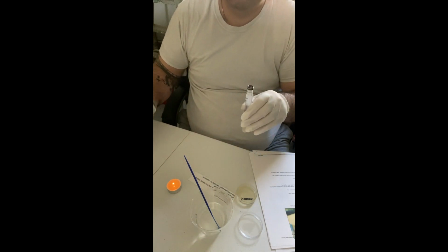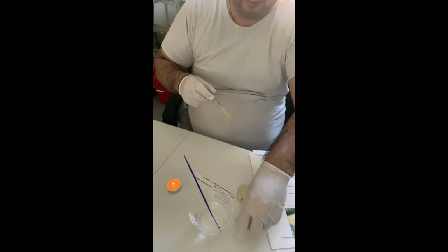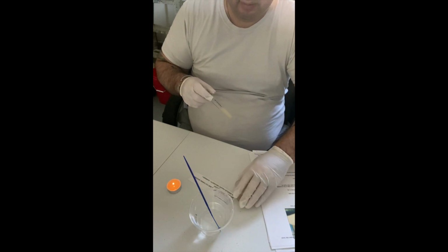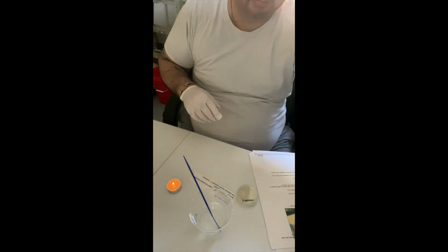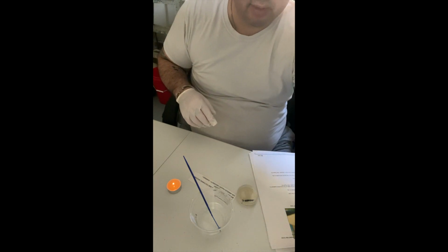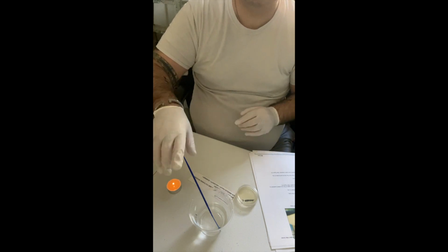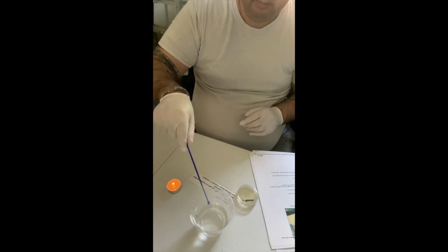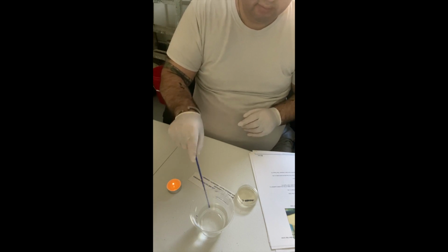Okay, that's been flamed. Lid on, and then all 3 cultures will be saved for future use. I actually have a mini fridge in my garage, which is my workspace, where I'm keeping all of these cultures and things of that sort. Okay, so it's been about 20 seconds. I'm going to go ahead and do that.